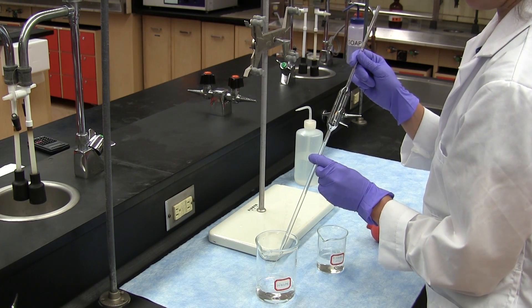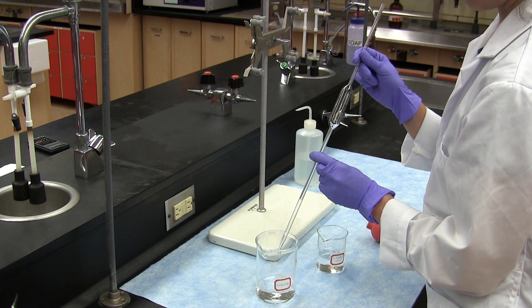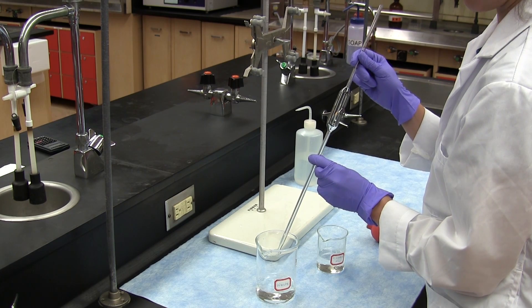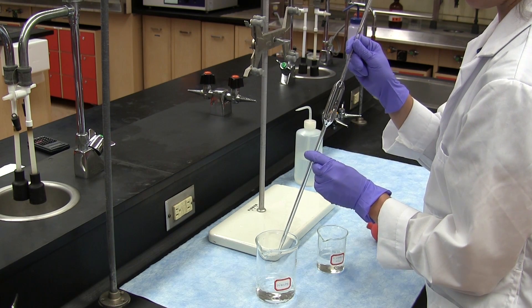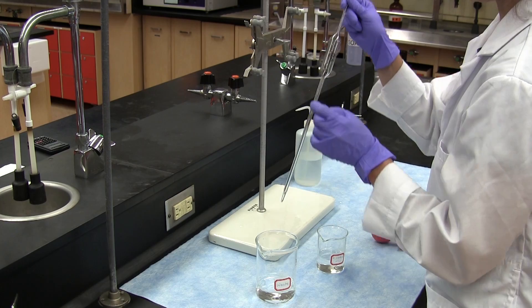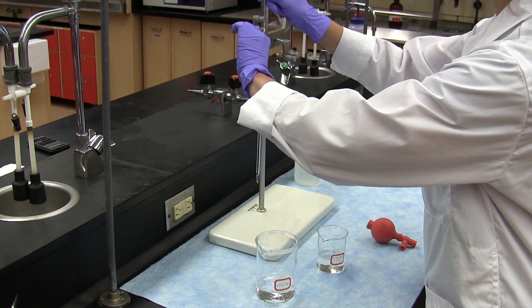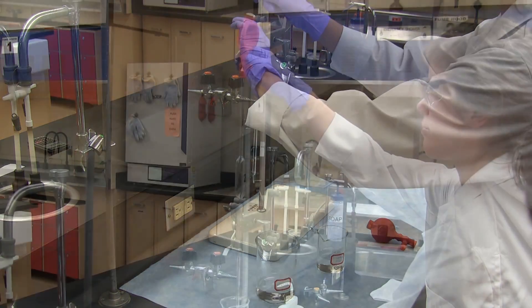This is repeated once or twice. So the pipette has now been cleaned and rinsed with the solution to be transferred and for convenience sake it can be placed in a vertical position using a burette clamp.